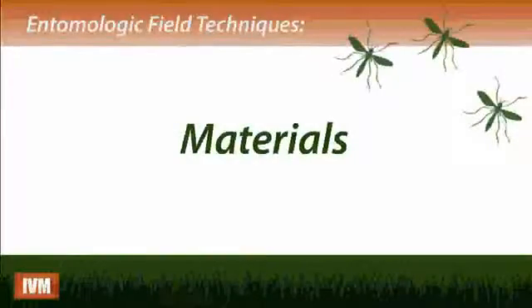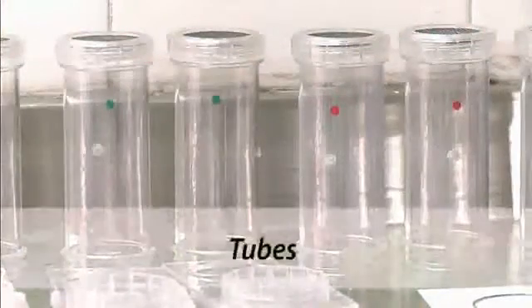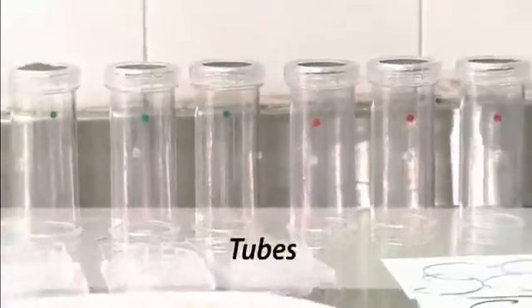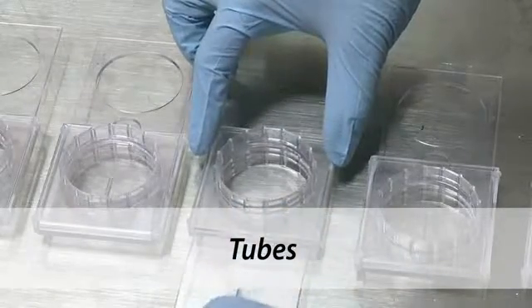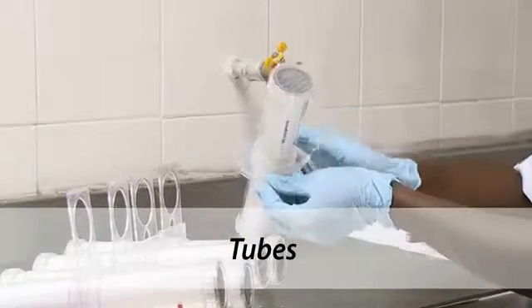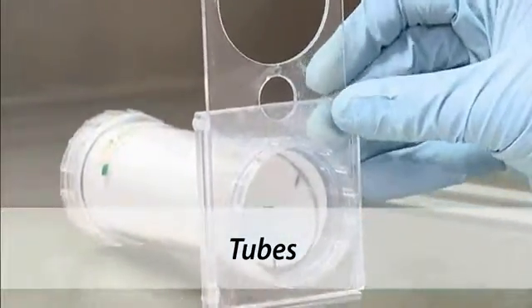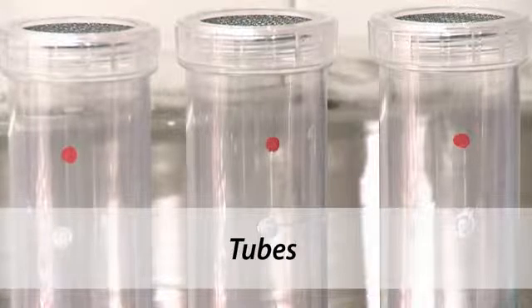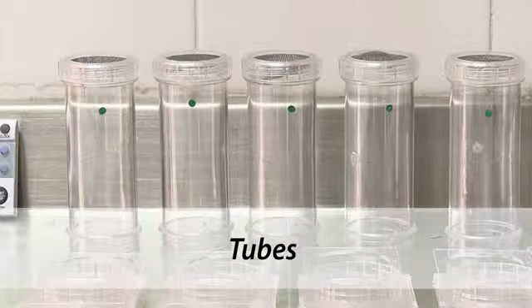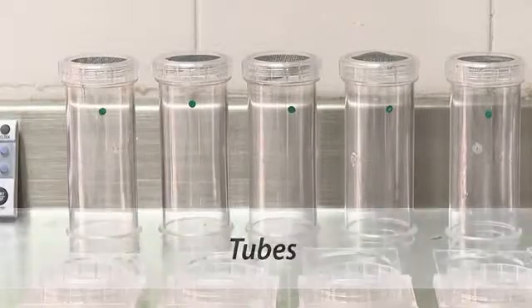Materials necessary for the WHO bioassay include the following: 4 exposure tubes and 1 control tube. Plastic tubes have screw caps on each side, along with a mesh covering on one end and a sliding plastic plate on the other, with a 20-millimeter hole through which mosquitoes are introduced. The tubes with red dots are used to hold the insecticide-impregnated papers. The green tubes are for the papers without insecticide: control papers and resting period papers.